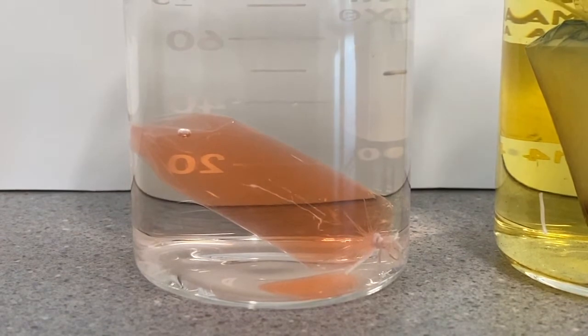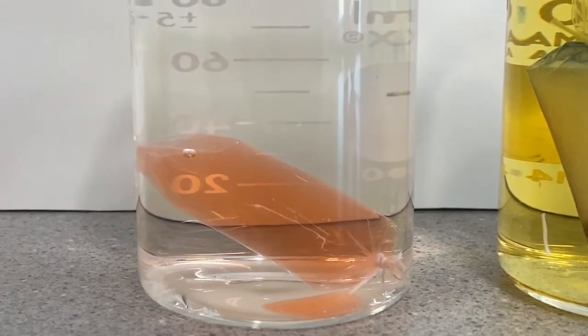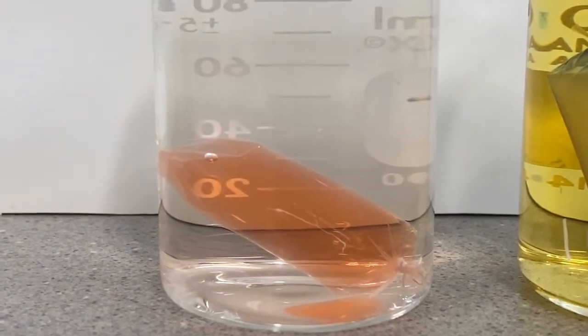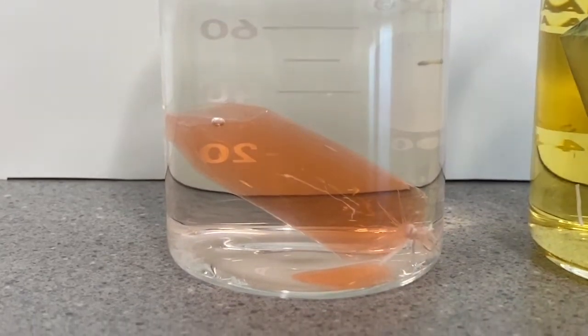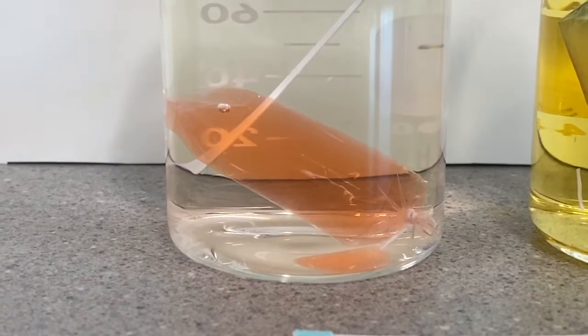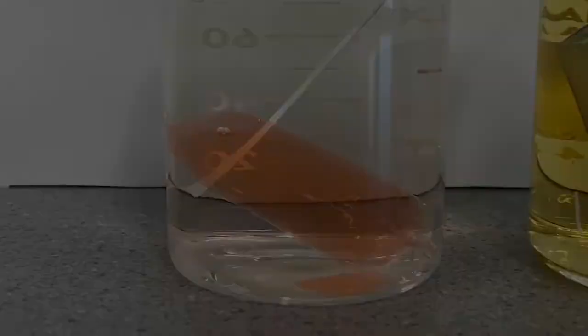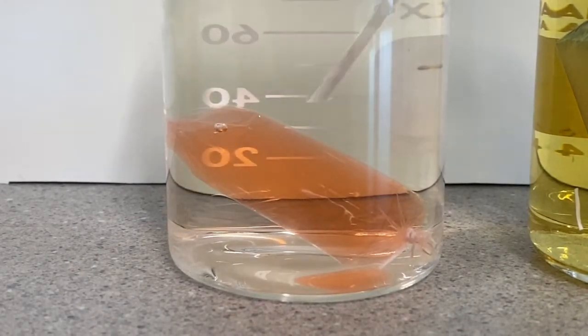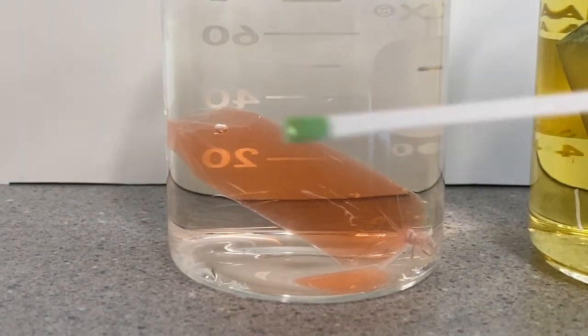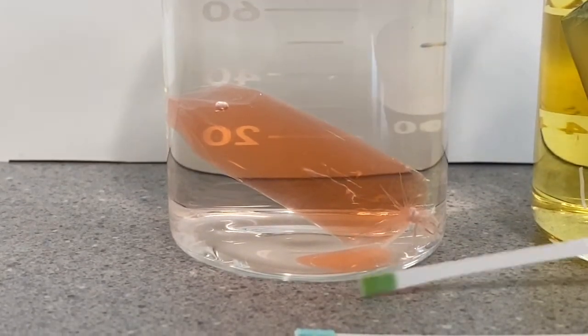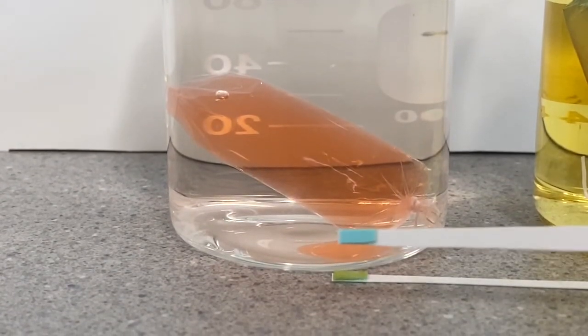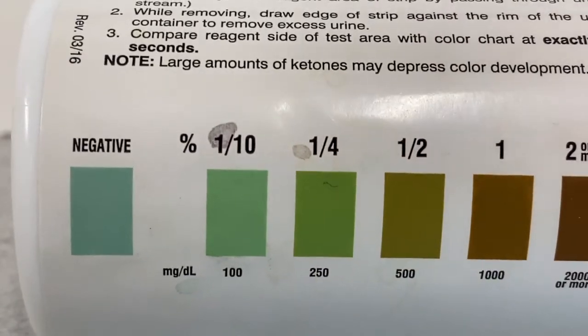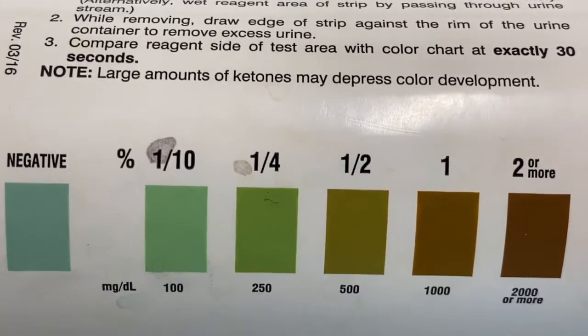As for our other cell, we're going to have to use these glucose test strips to test the water and see if the glucose made it out of the cell or not. I got two of these test strips just because I want you to be able to compare the original with what happens after. I'm going to leave one of these outside, and then I'm going to take the other one and dip it down inside of this container and leave it there for about 30 seconds or so. After waiting for a little while, I should be able to take it out and compare it to the other test strips. Here we can see that this one is fairly green, and if we compare that to what we started with, which is this kind of blue-green color, you can see that there definitely was a color change. And that color change indicates to us, based on this scale here, that we do in fact have something in the water that is causing that color change.